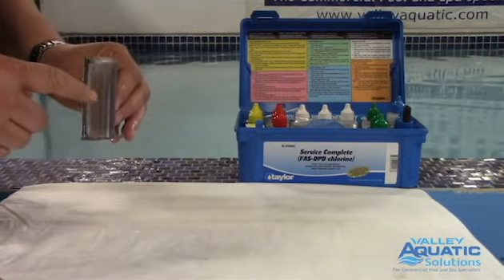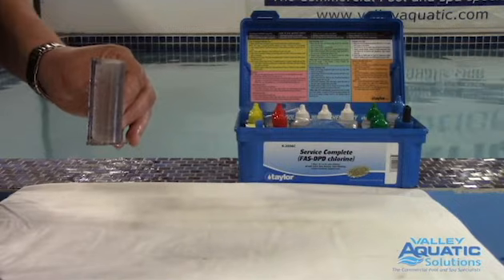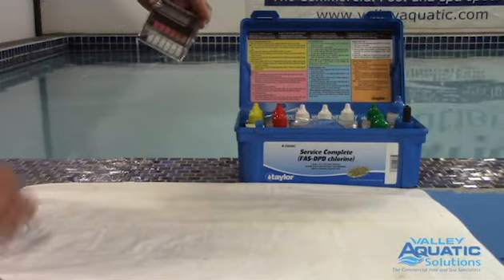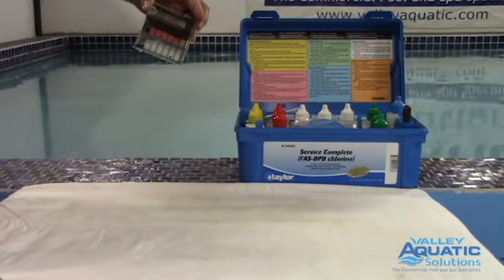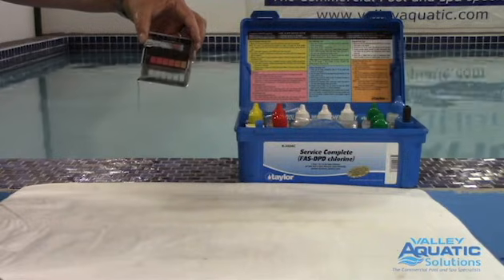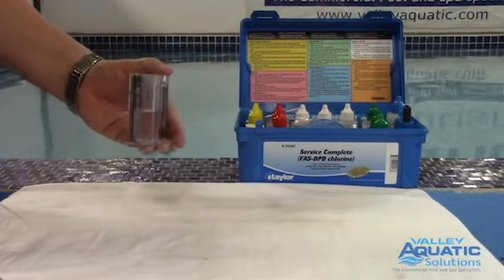For free chlorine I want 25 milliliters. Taylor taught me an incredible trick: tilt the comparator so the water line touches the corner. When it touches the corner, you have 25 milliliters every single time. Incredible.